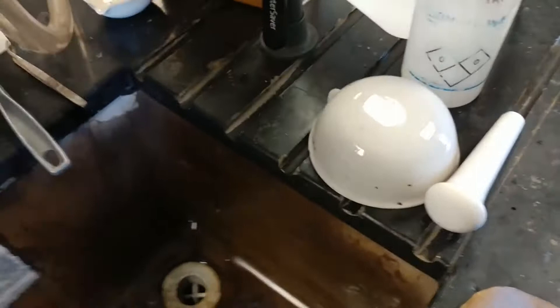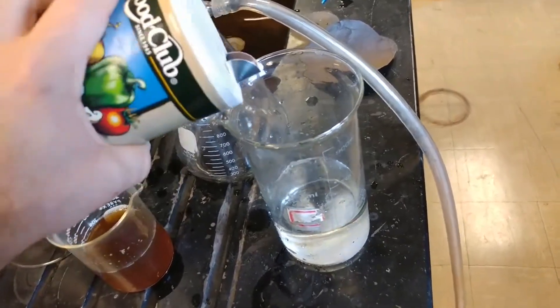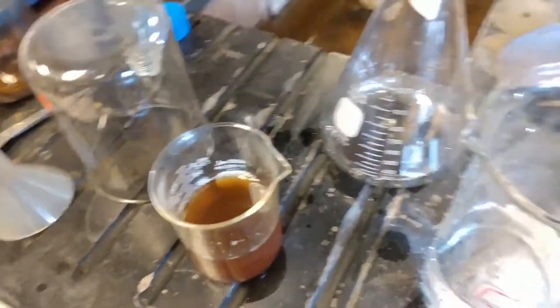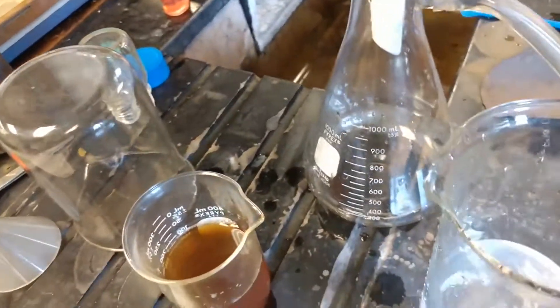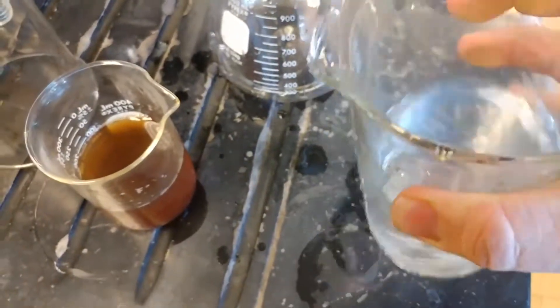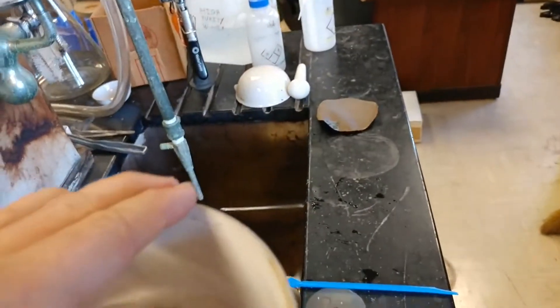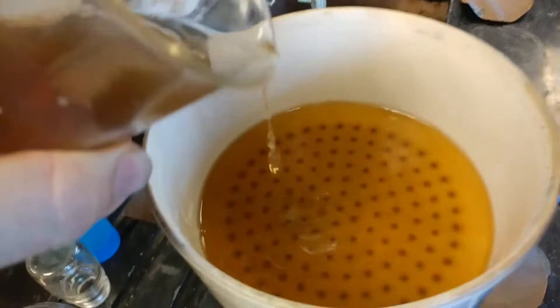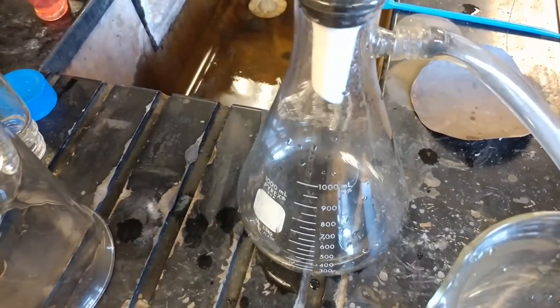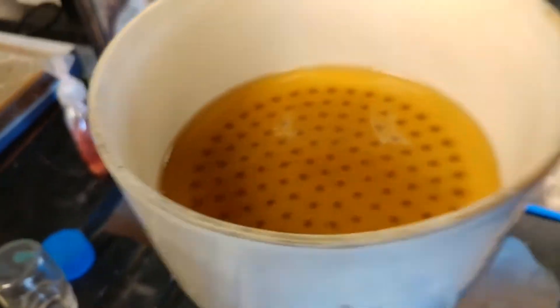So what am I doing? Well, you know what I'm doing. We're gonna take some of this, put it in there, put some of this over here. This is a wiggly video. Make sure you can taste the salt — delicious electrolytes, this is Gatorade. H2O. Anyway. So basically I'm trying to make a film with this filter, with the GO. Pour that in there. It's a little red looking, but it'll come out just a little bit. And then what'll happen is this will go through and this will create a film layer. It's already got some in there, but we're gonna try it.